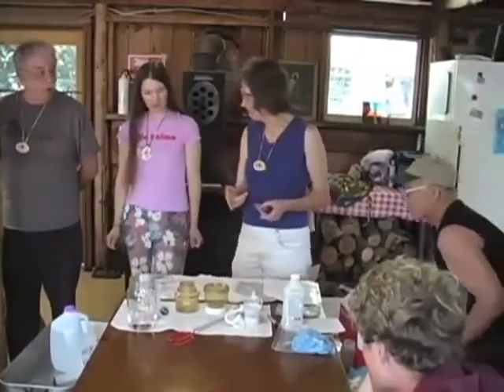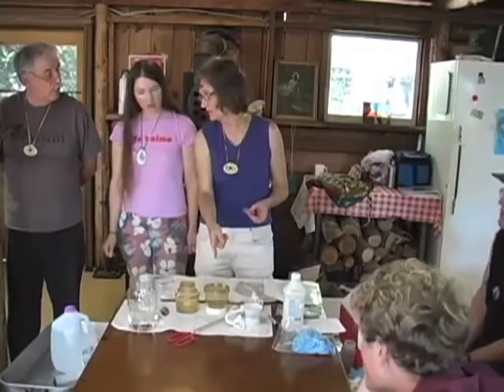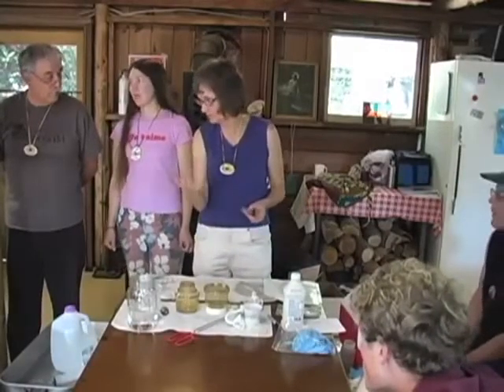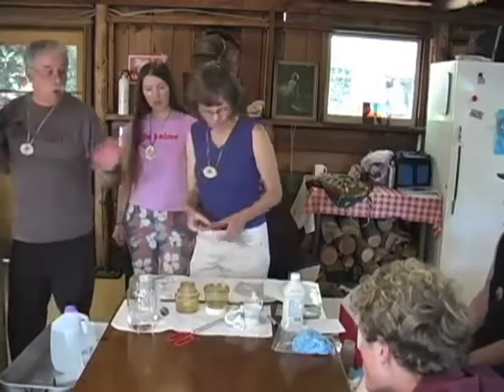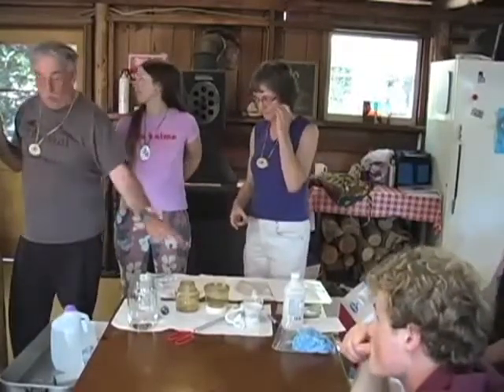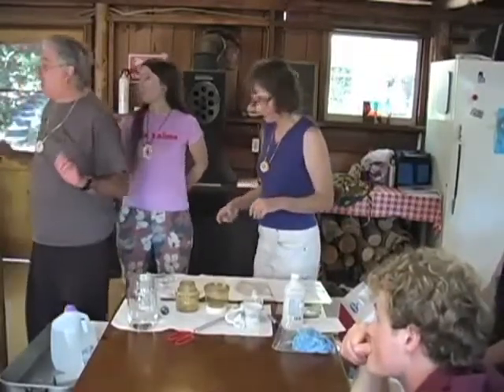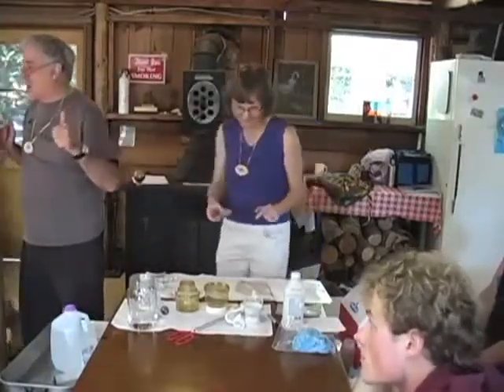Now you know what we have to do, though, if we really want to be sterile, we have to boil this top unit now for 5 minutes. So anybody who wants to hang around, we're going to go work with Dell, but we want to do one more test, but we have to boil this. We want somebody who thinks they have clean hands, but didn't wash them, and we're going to do a thumbprint.